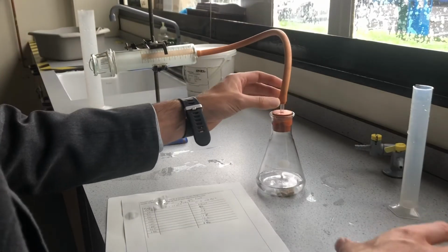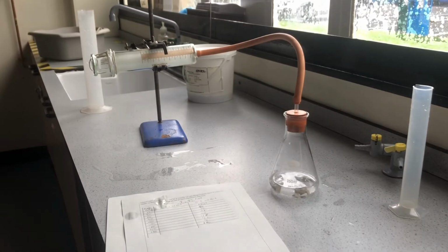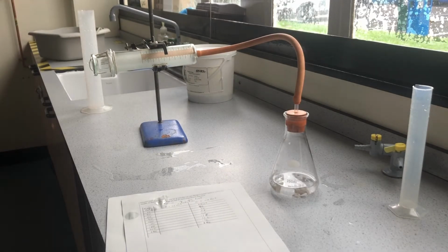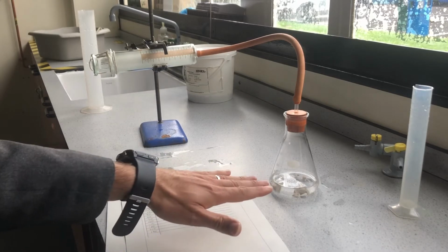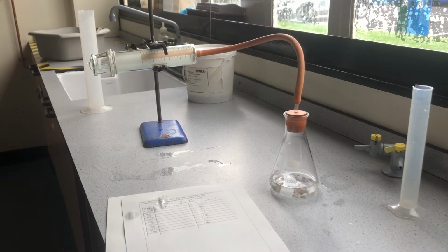Again, we'll tip in the hydrochloric acid, put the bung in, start the watch, and get started. Now, this should go noticeably slower, okay, because the acid is more dilute. Now, the other thing about using a more dilute acid, in more dilute acid there are fewer acid particles present, so we should get fewer collisions, so the rate should be slower at the start. The other thing about using fewer acid particles, same volume, don't forget, it's just more dilute.